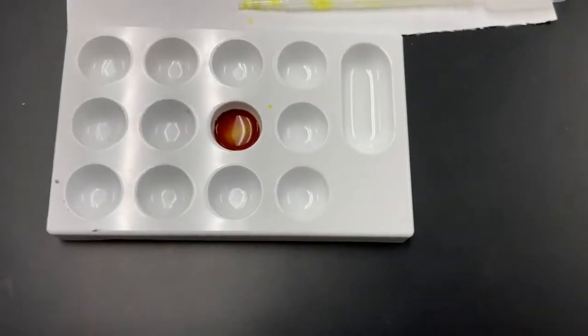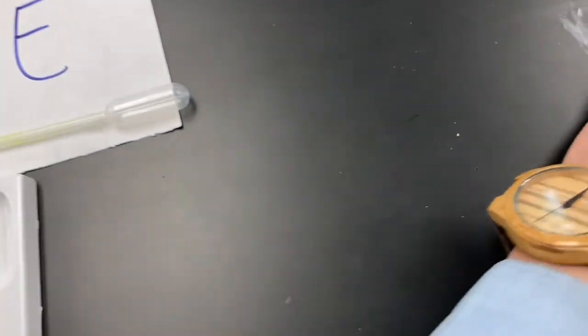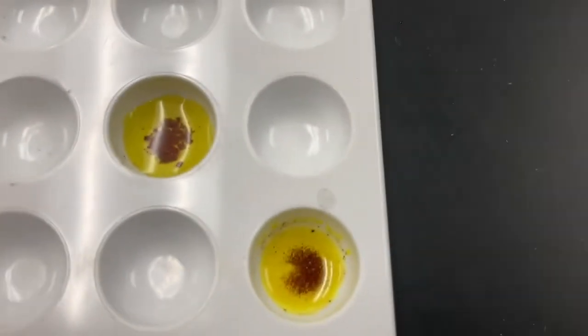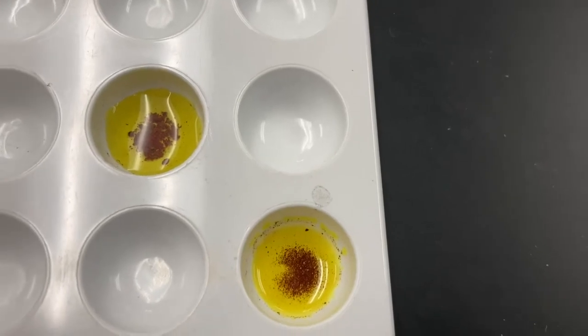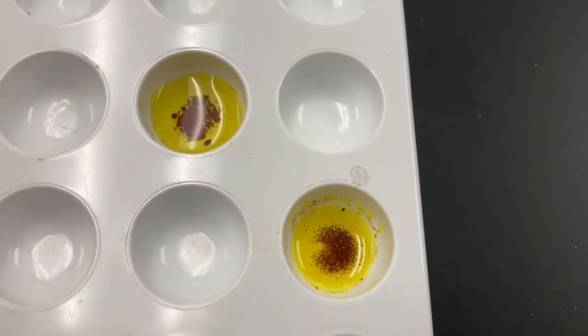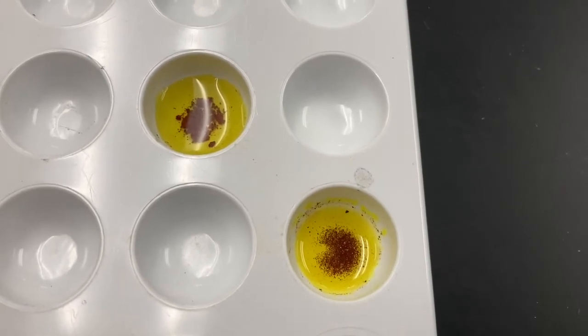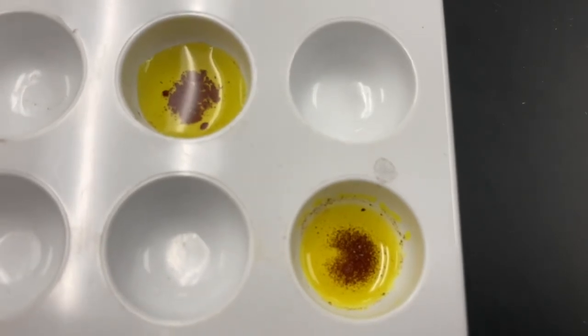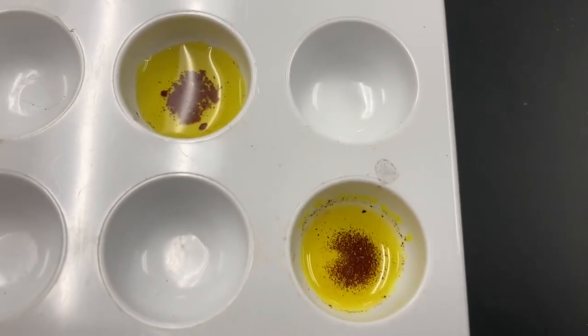If you want to take a look at kind of a before and after, here's what happens after that stuff settles. You can get a good look at the products here. So that's what we call a precipitate. Again, a precipitate is a solid formed from two chemical solutions. There you have it. This is our last and final part, part E here.